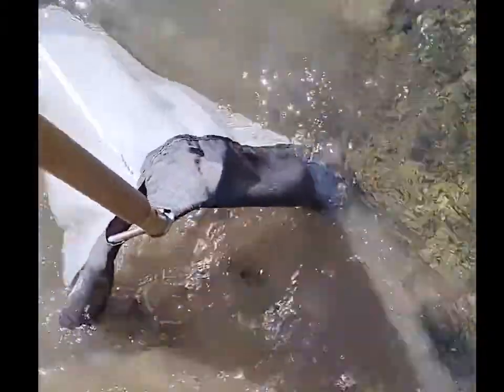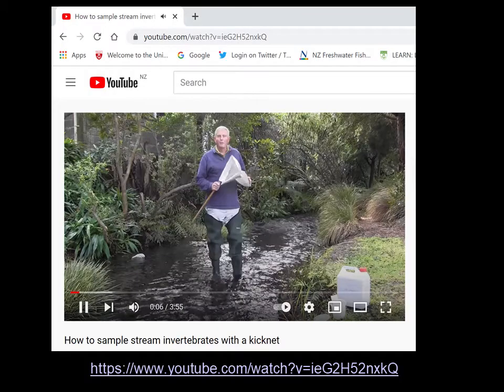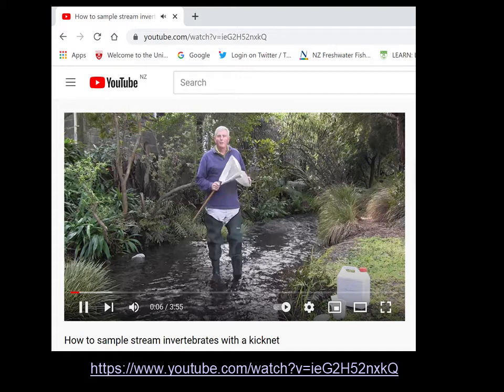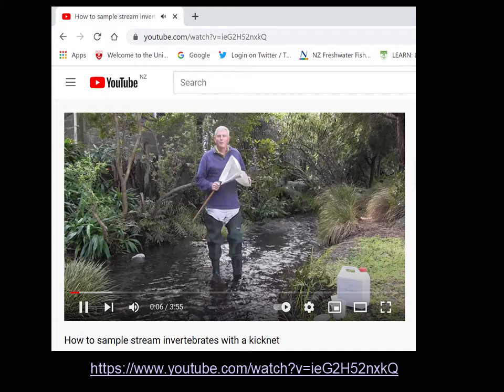You're going and taking some sort of sample in the field — this might be a kick net or some other sort of method. If you're not sure about that, I do have another video you can have a look at, which is how to take a kick net sample.